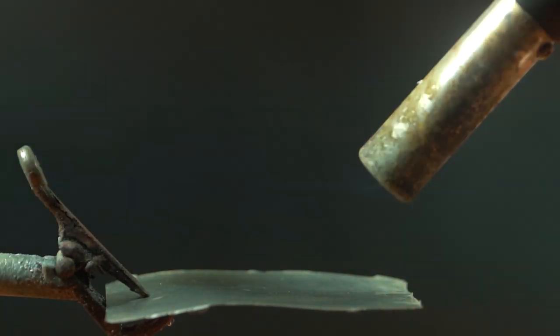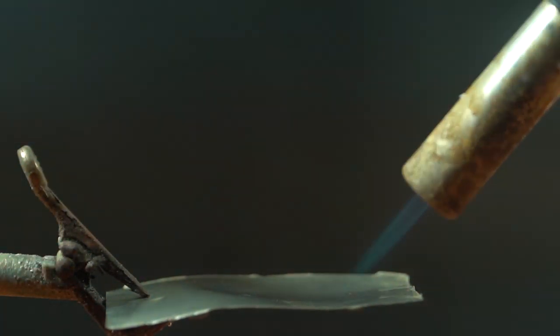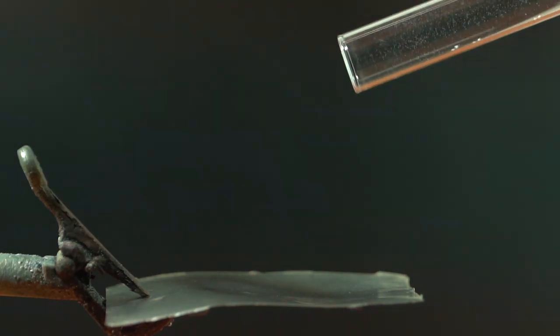If you heat these crystals really fast to above 200 degrees, they can detonate. To do this I decided to pour them on a hot metal plate.